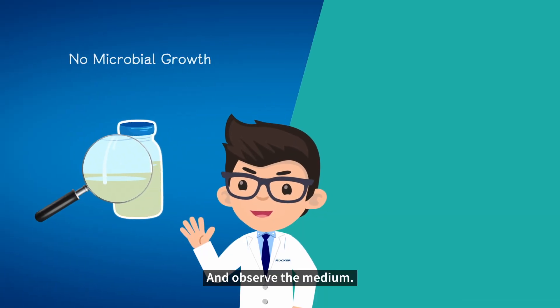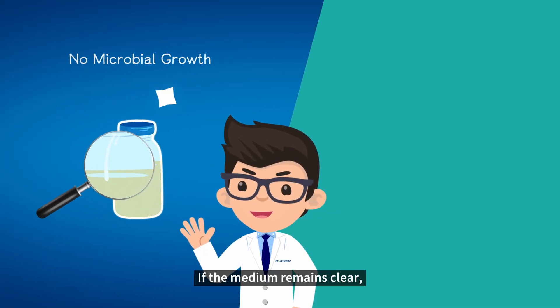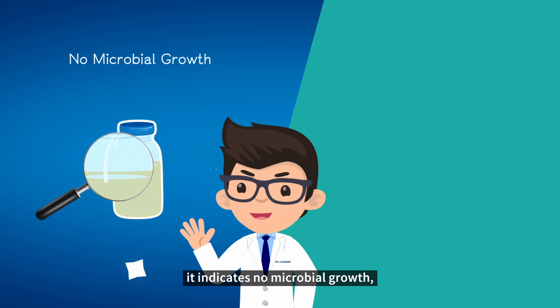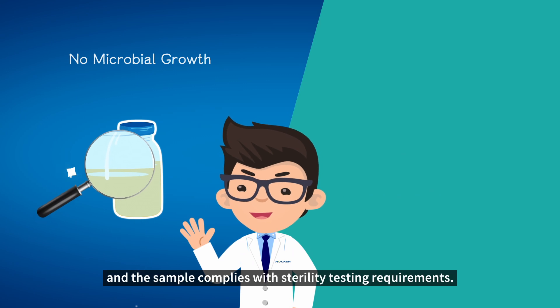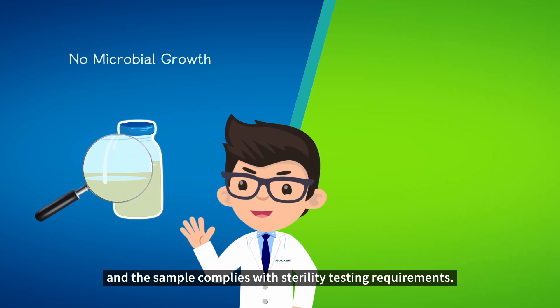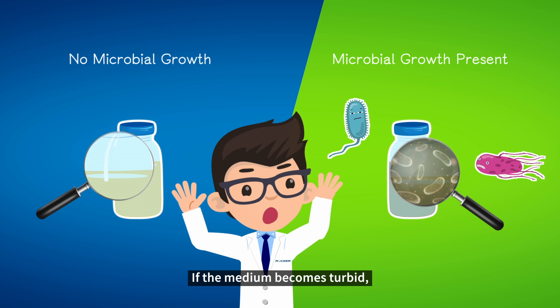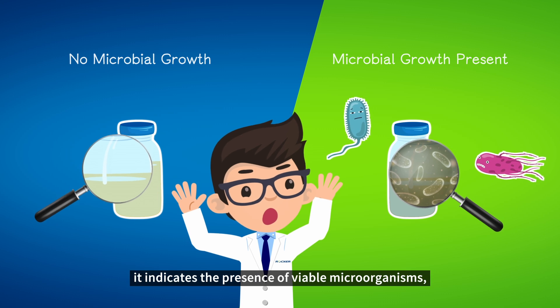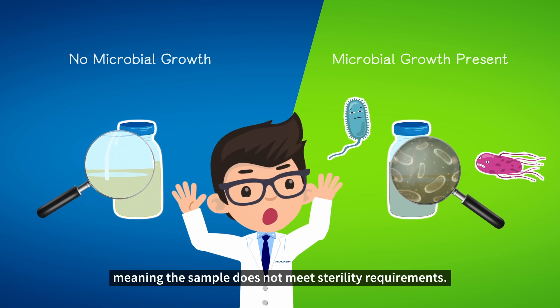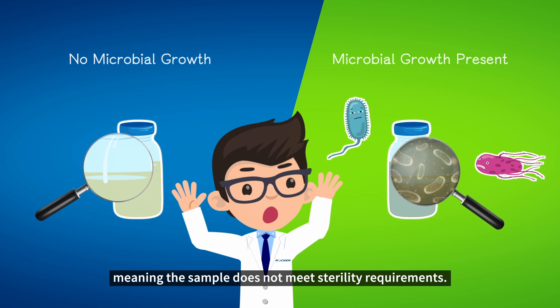Observe the medium. If the medium remains clear, it indicates no microbial growth and the sample complies with sterility testing requirements. If the medium becomes turbid, it indicates the presence of viable microorganisms, meaning the sample does not meet sterility requirements.